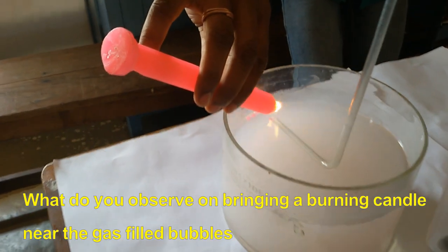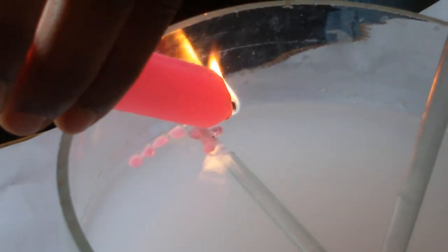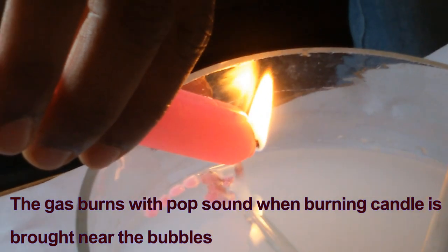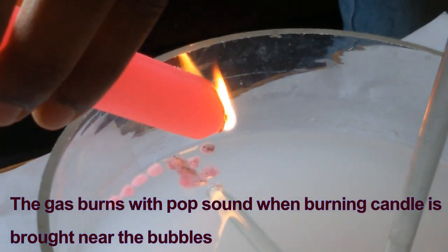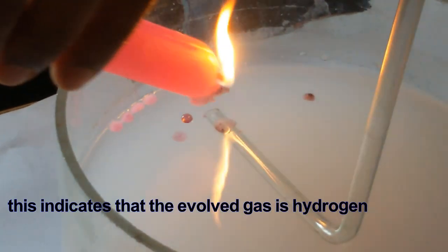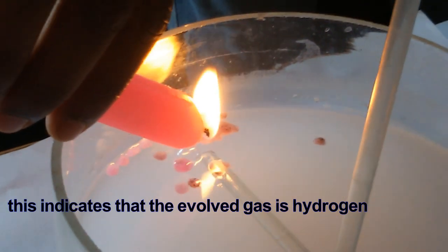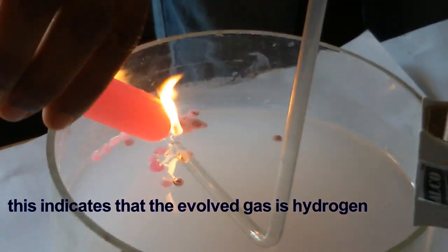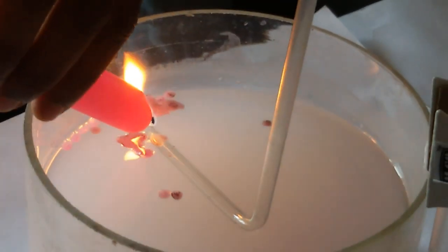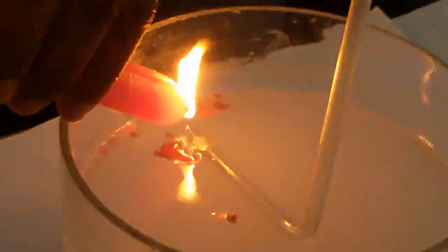What do you observe here on bringing a burning candle? The gas burns with a pop sound when the burning candle is brought near to the bubbles. This indicates that the evolved gas is hydrogen. When you burn hydrogen, it gives a pop sound, so we can say that the evolved gas is hydrogen gas.